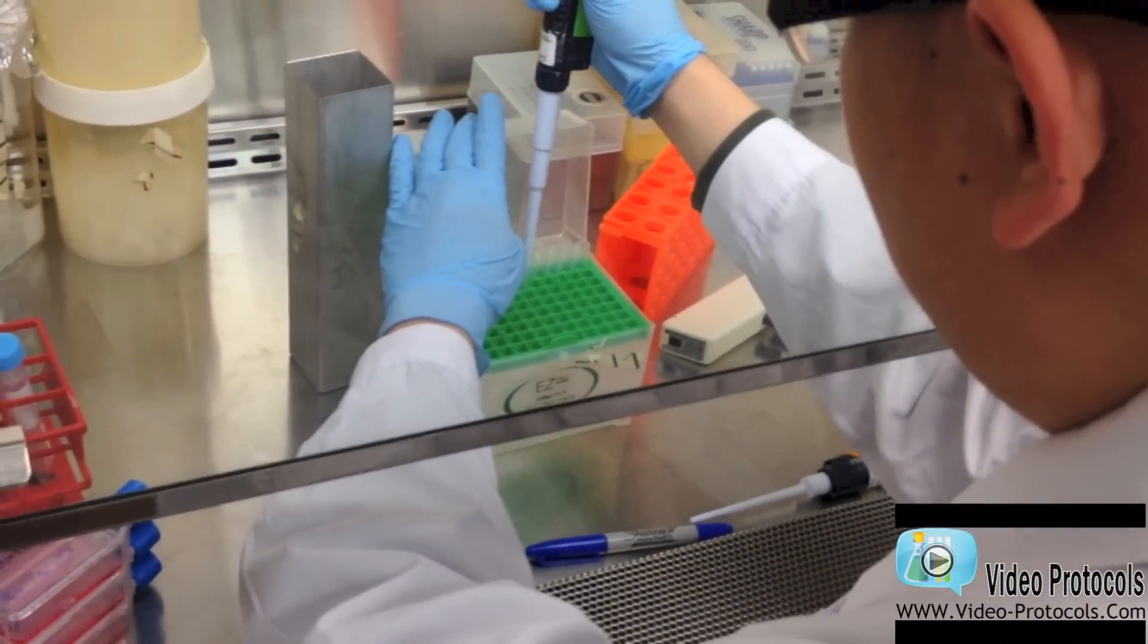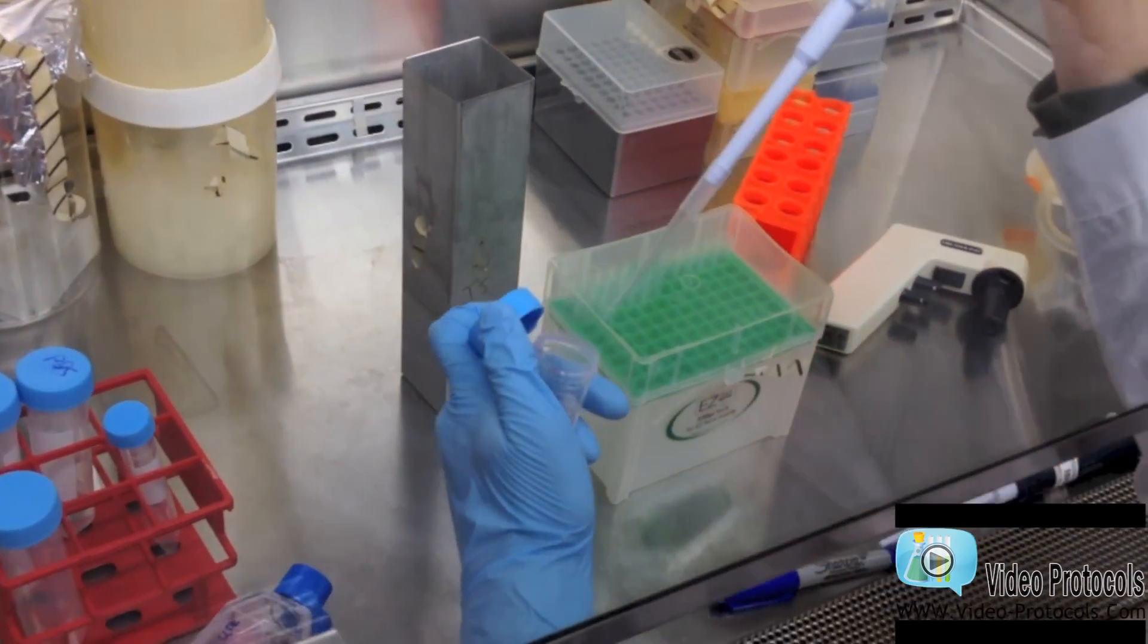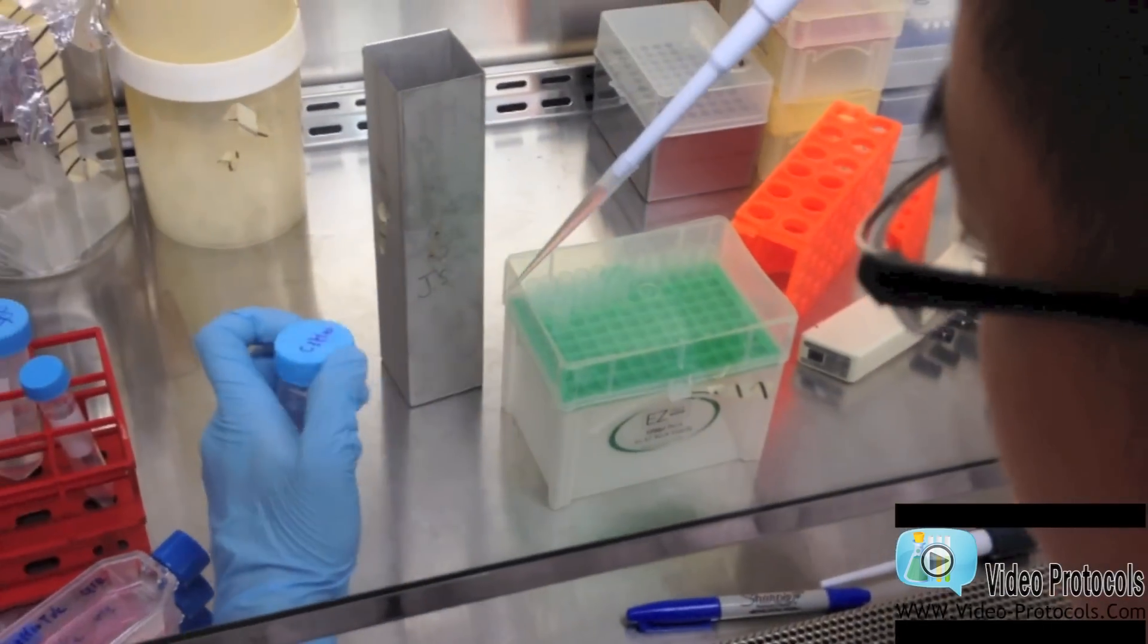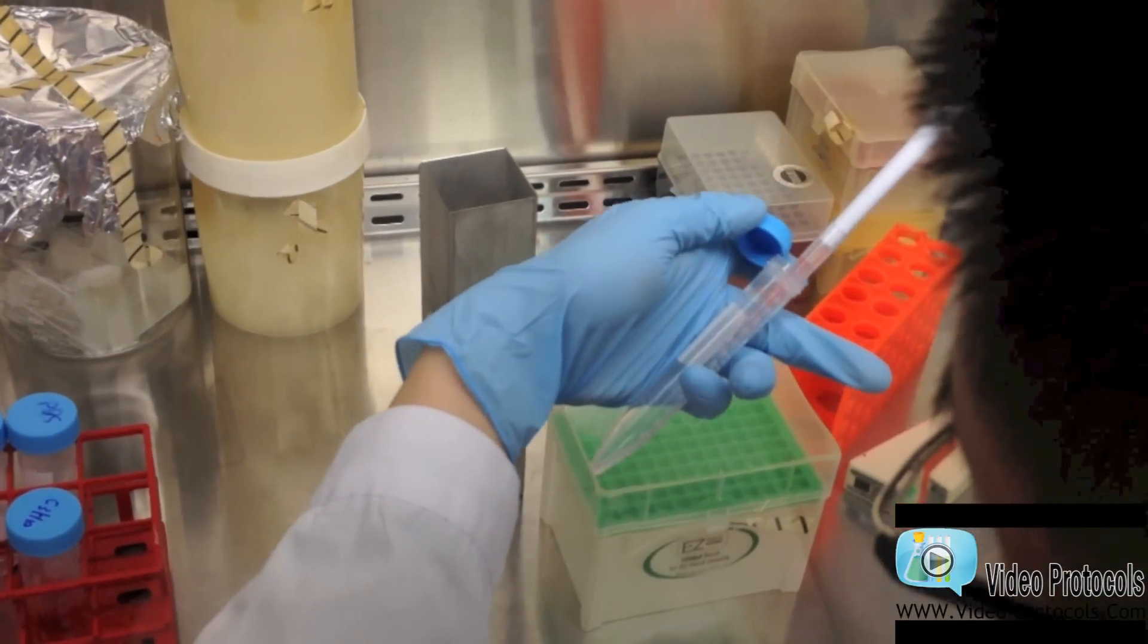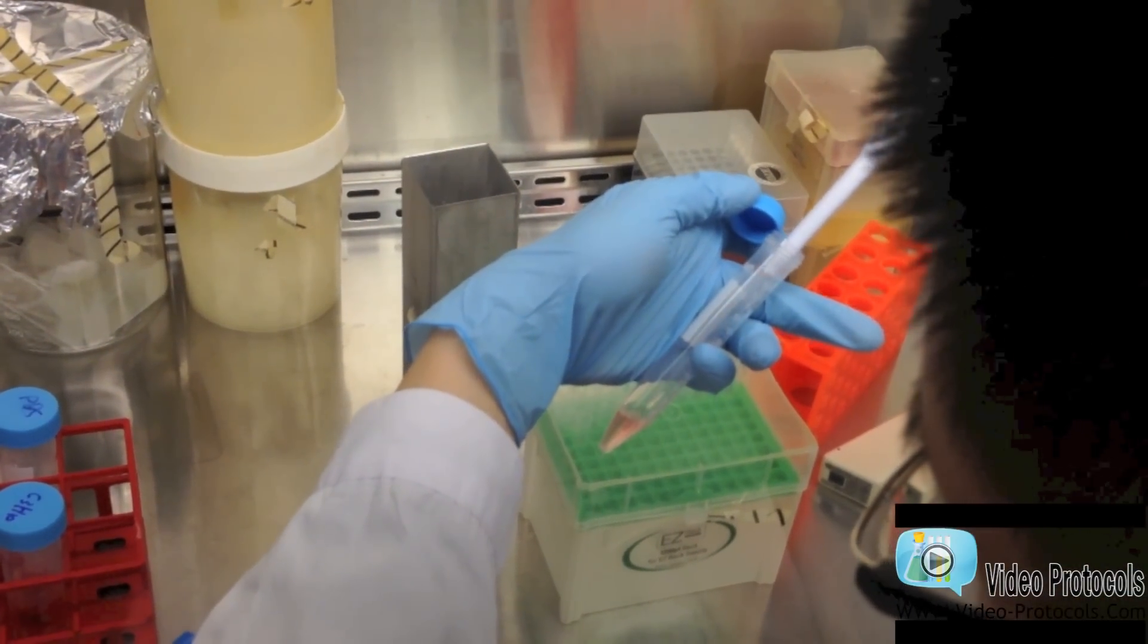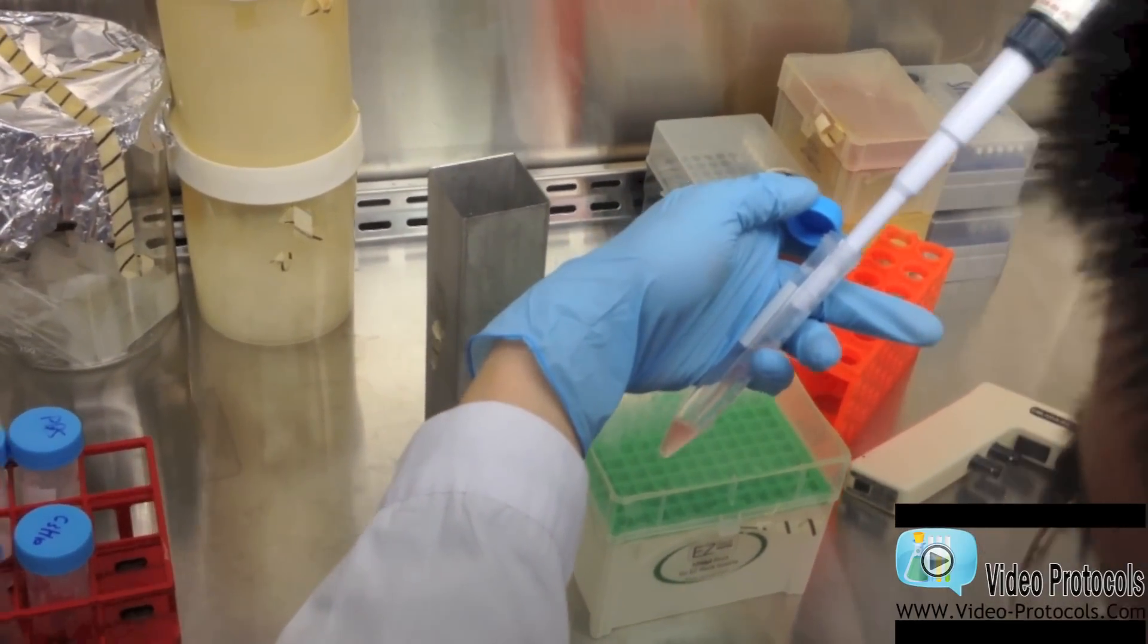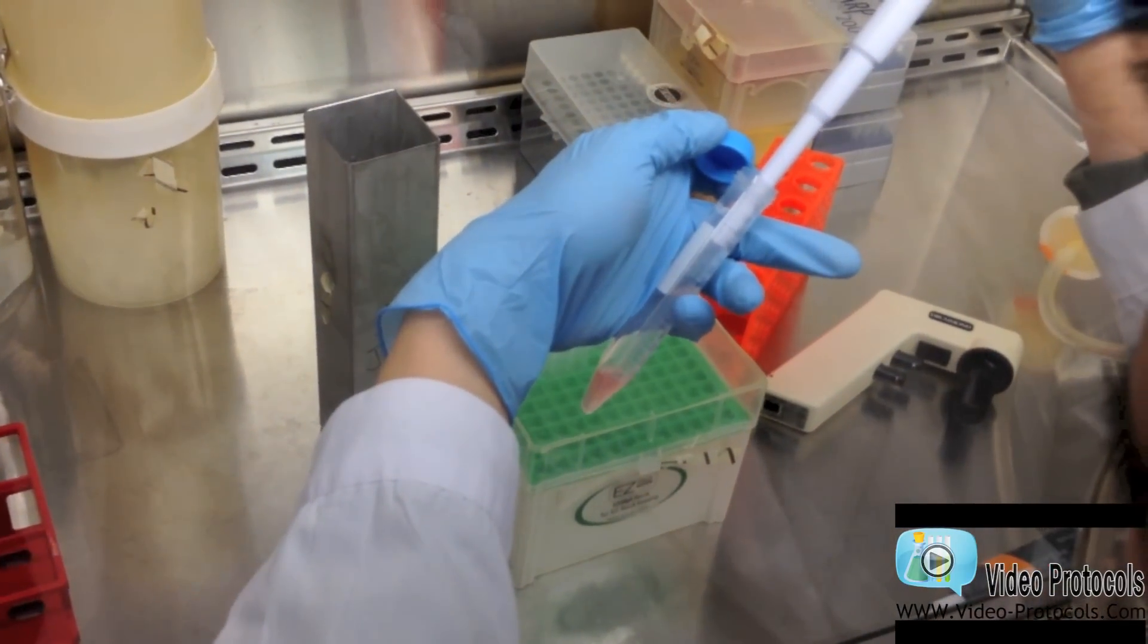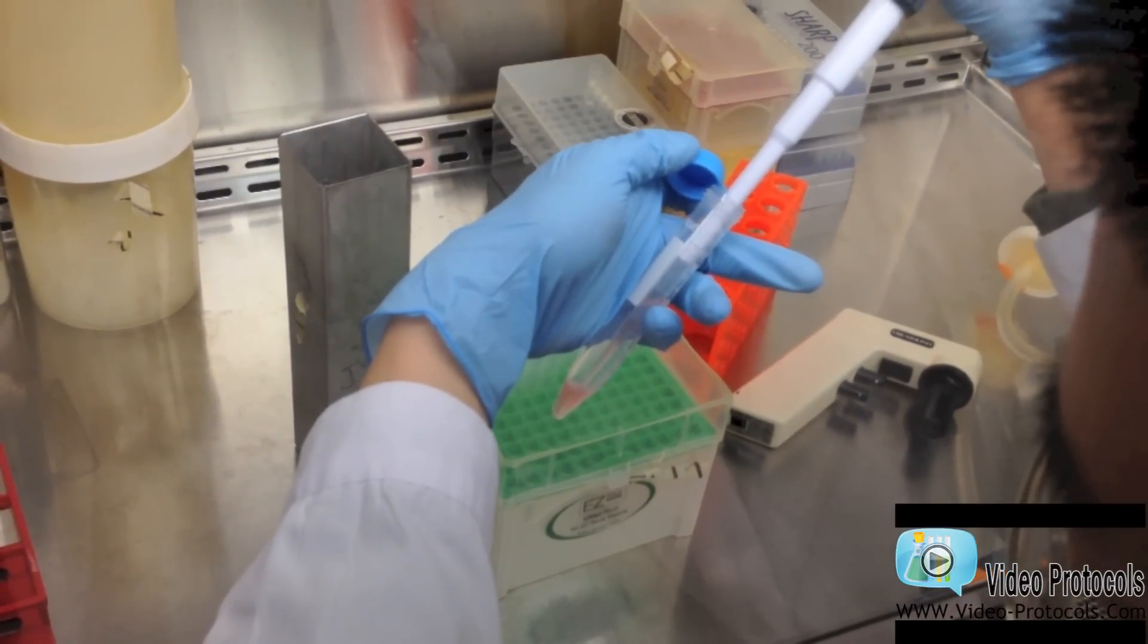I will then resuspend the cells in 1 mL media. Pipette it up and down to make sure the cells are homogeneously distributed.